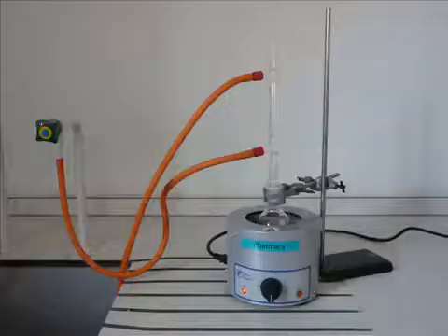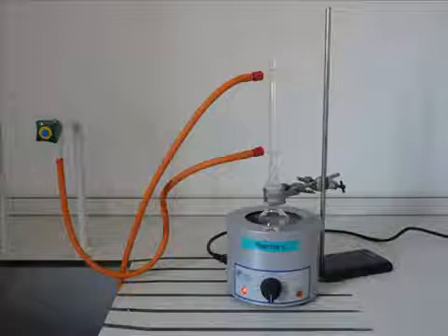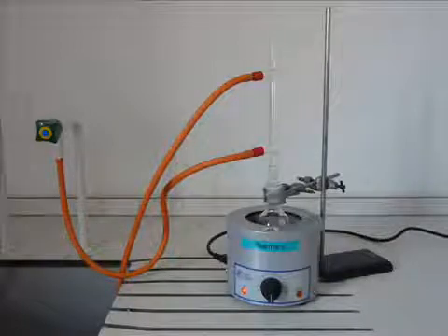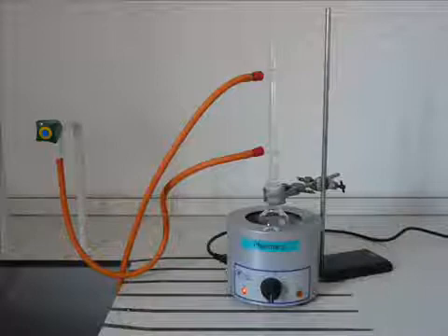Cold tap water circulates through the condenser jacket and vapors that are formed during the heating are cooled, condensed and returned to the flask. Thus, refluxing allows prolonged heating without the loss of reaction mixture due to evaporation.